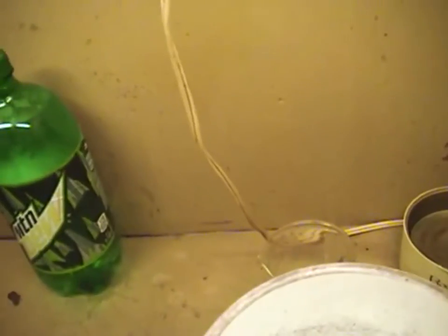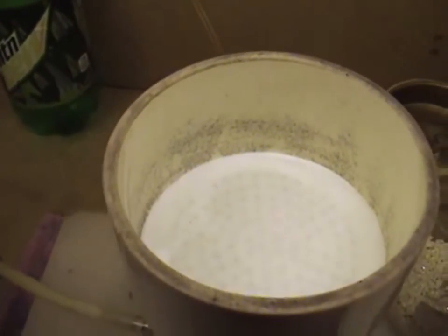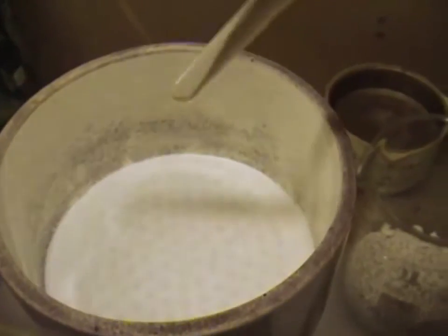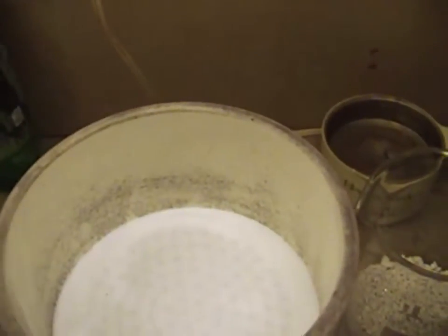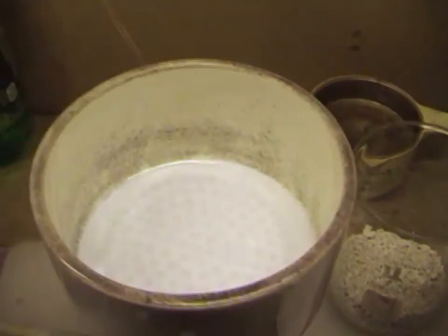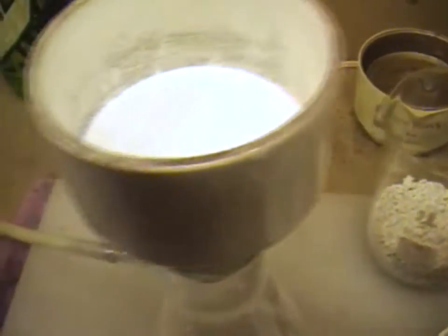I need to point out — what you want to do is make sure you've got a good seal against the bottom of that funnel. You can take a round glass stirring rod and put it around the edge, traveling around that edge to mold that filter paper to the contour of the bottom of the funnel. Then come back and squirt it with a little water, and that will seat your filter paper in there.